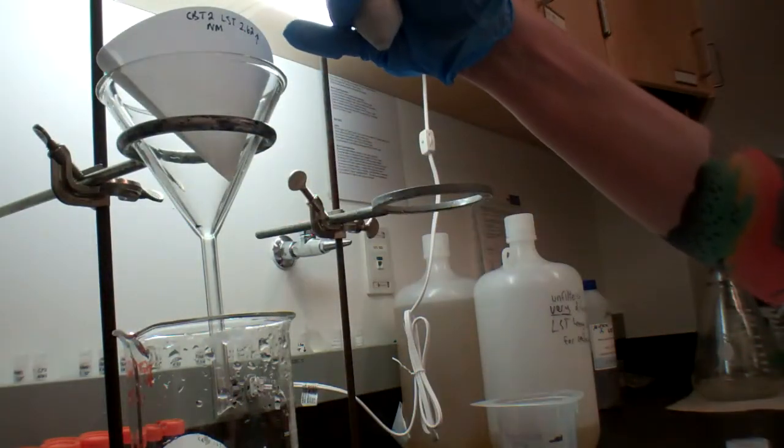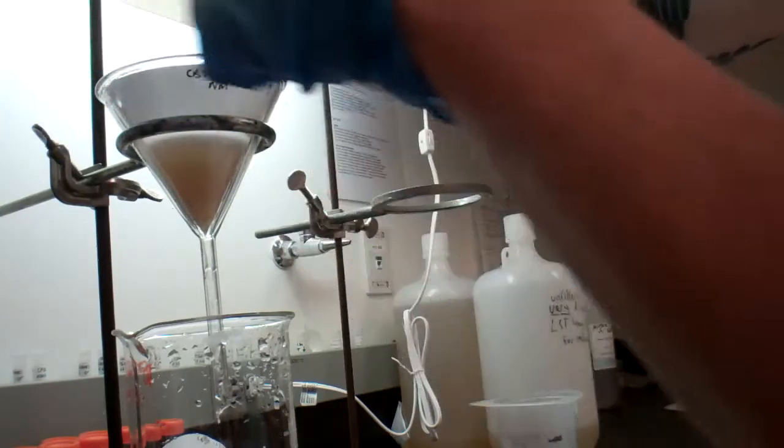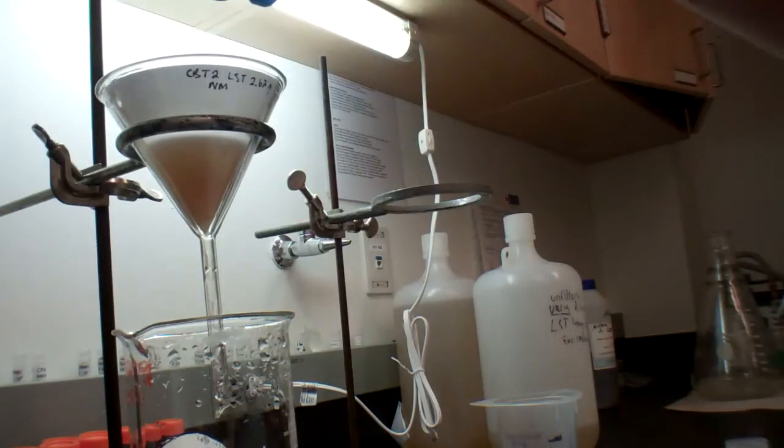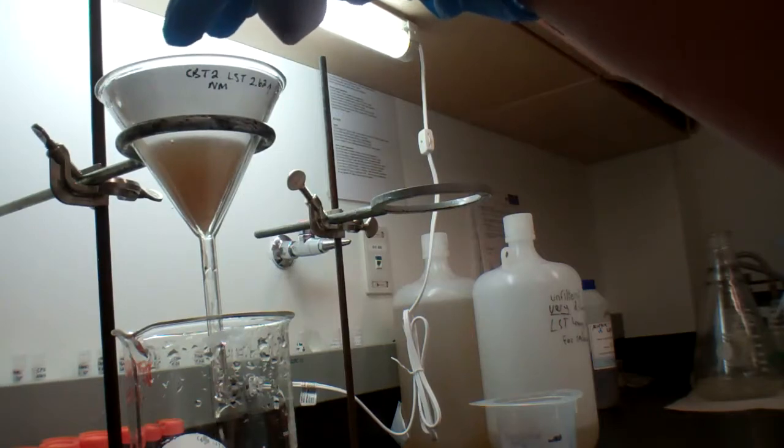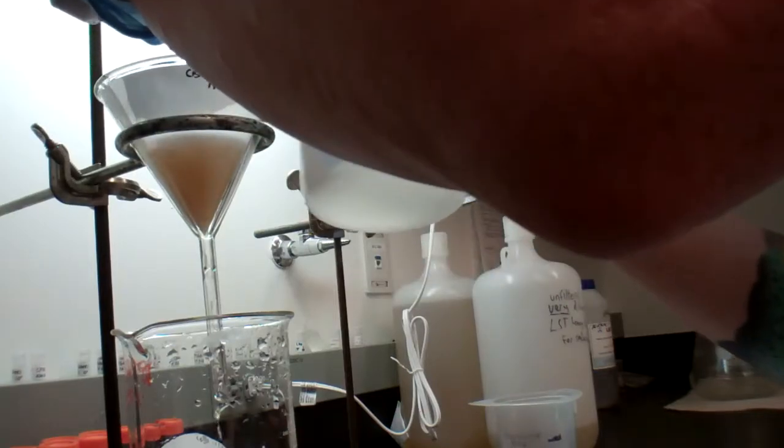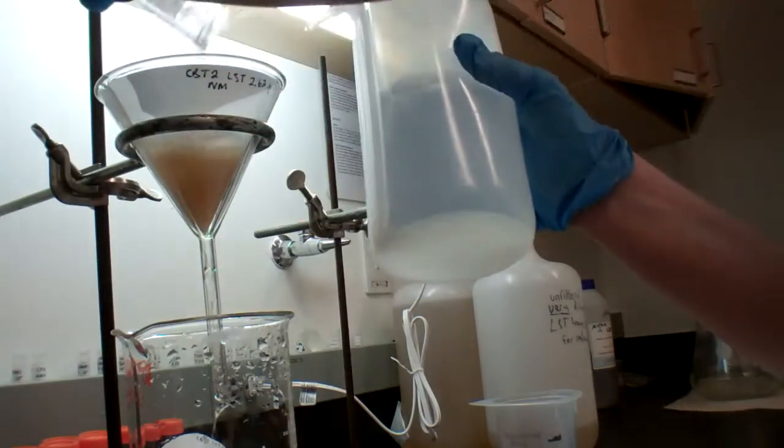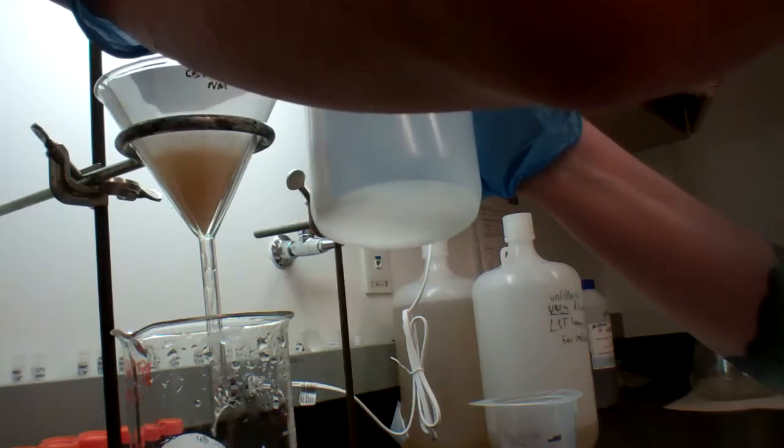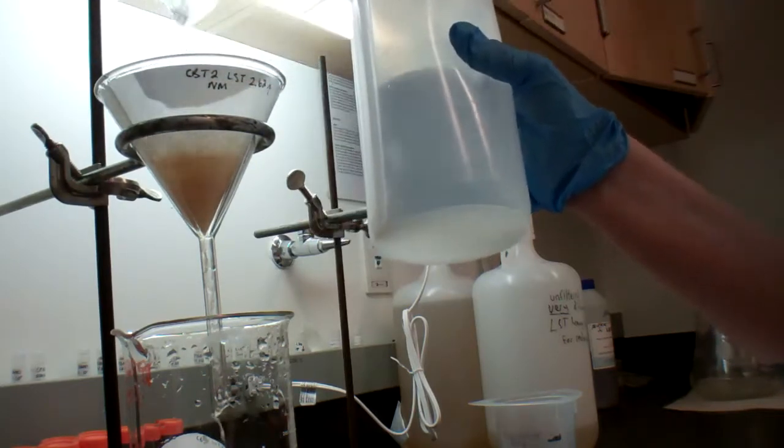I want the floats. I'm going to carefully unscrew the top and pour it into the correctly labeled filter paper. And now it's going to filter through the filter paper and I want to get all of those little bits out.